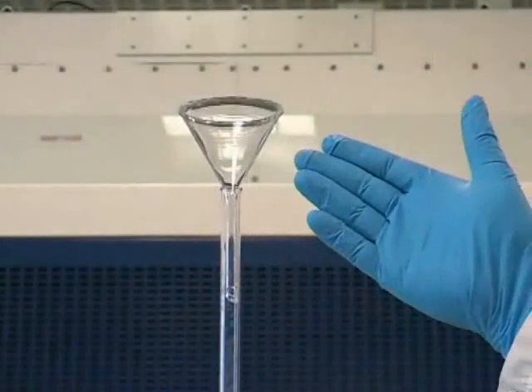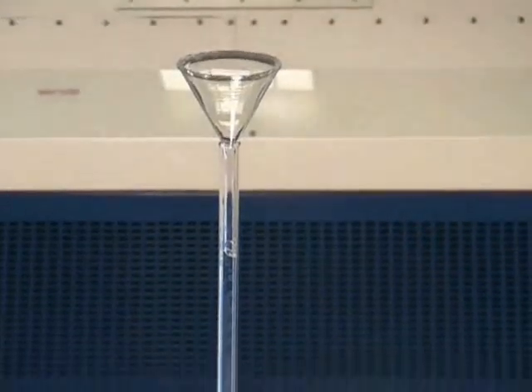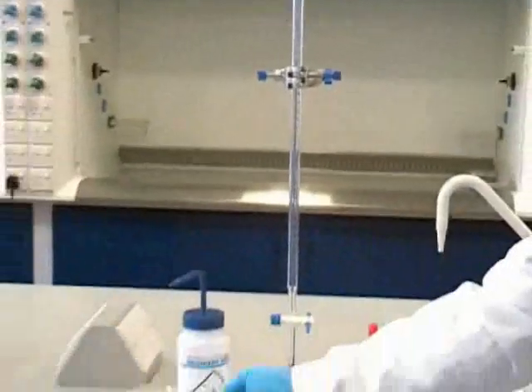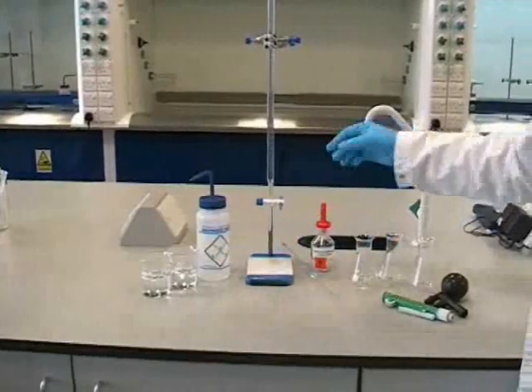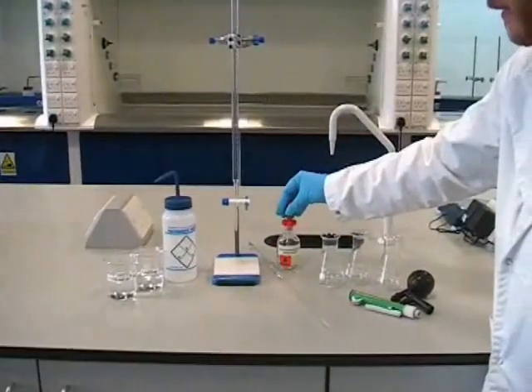Before filling a burette, we should make sure we've placed a small glass funnel in the top. We should also make sure we've got the rest of the equipment we need, including solutions, distilled water, a suitable indicator, in this case phenolphthalein.